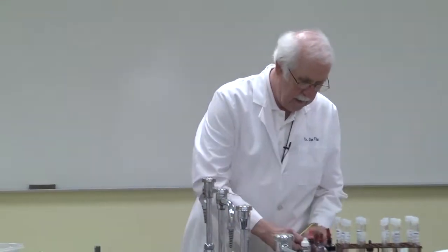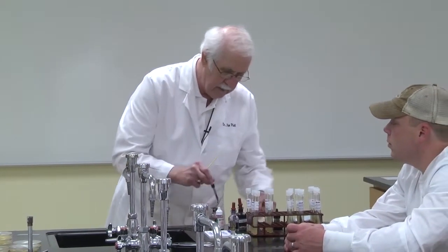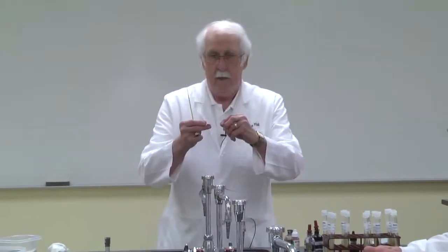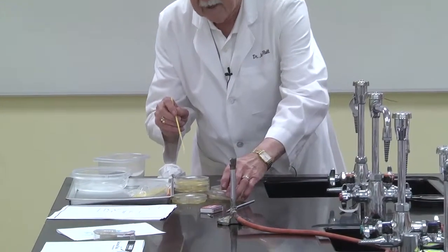The first thing we do now is put a single drop of nigrosin at the end of the slide. This is the only staining procedure in which we will do that, putting it at the end of the slide, like this right here. Then we lift up the edge of the plate, treating everything as if it's potentially pathogenic. We lift this up, and then we put that right back down.